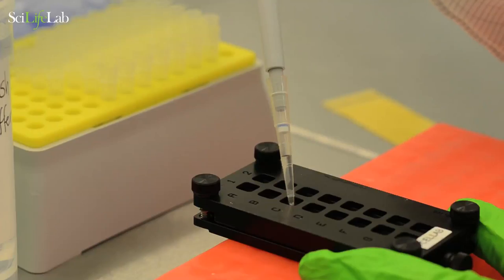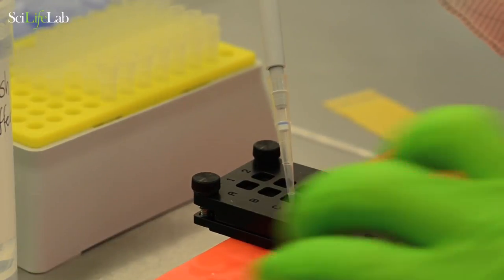When all wells are empty, add pepsin and incubate at 37 degrees.